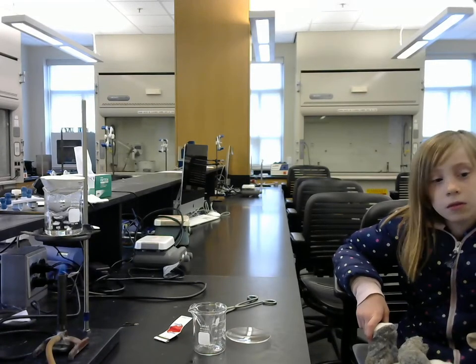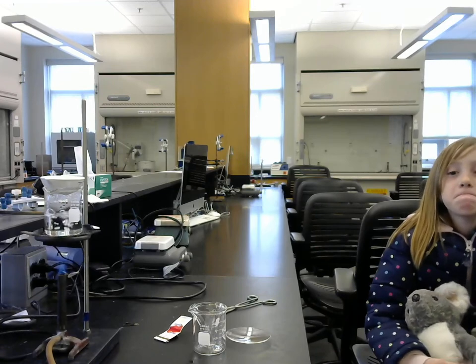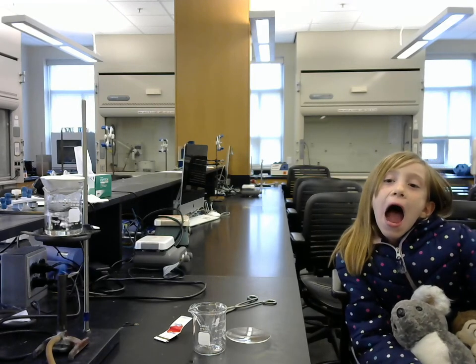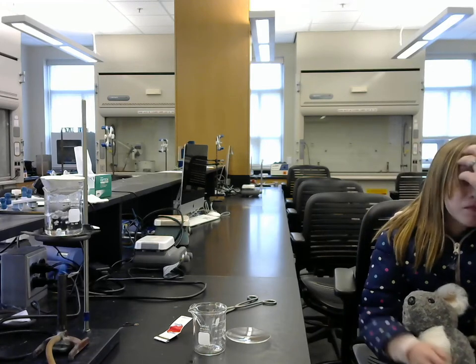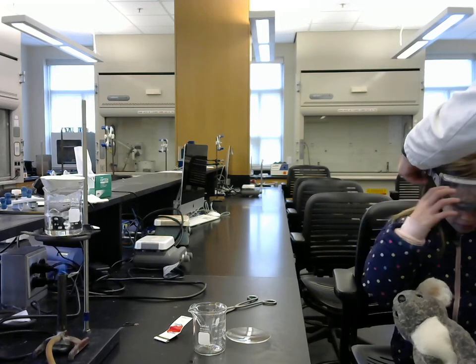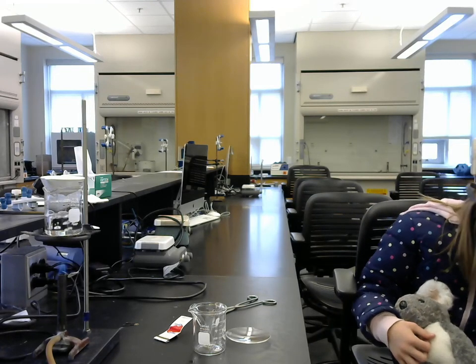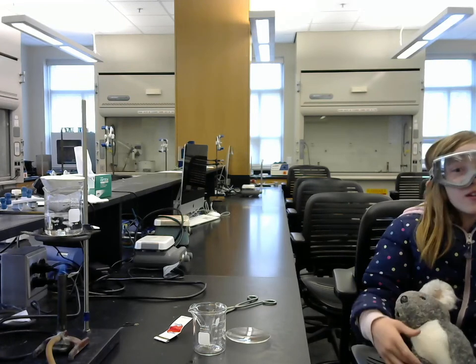Okay, I thought it'd be fun if we have Lily here. Hi. Do the lab procedure according to my instructions. And the first thing she needs to do is put on some safety goggles. Let's get your hair out of the way. Monkey. Oh, monkey caught on by his tail. Look at that. Oh. You were lucky, monkey. Okay, I look like a scuba diver a little bit.